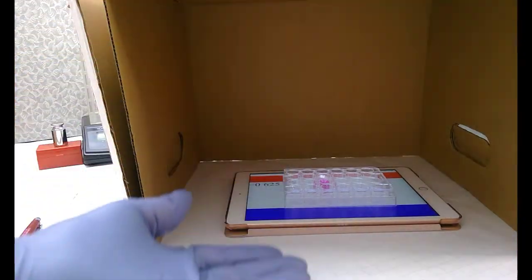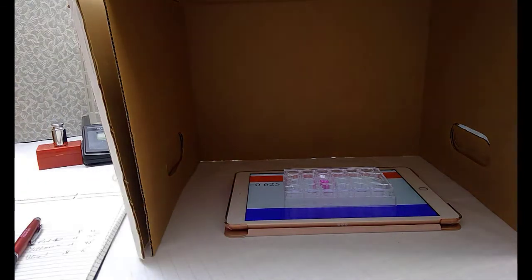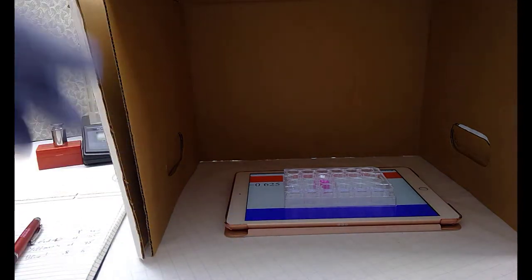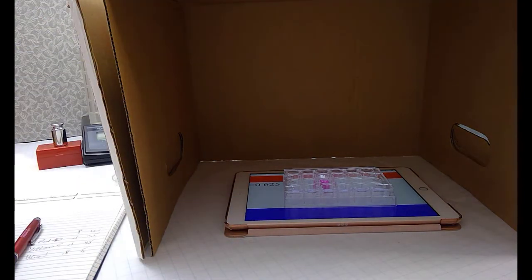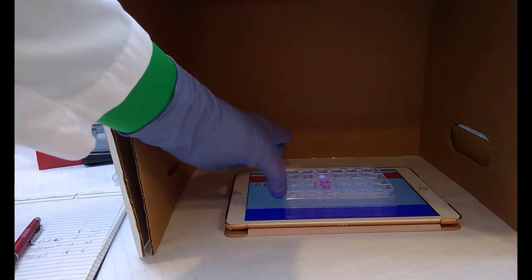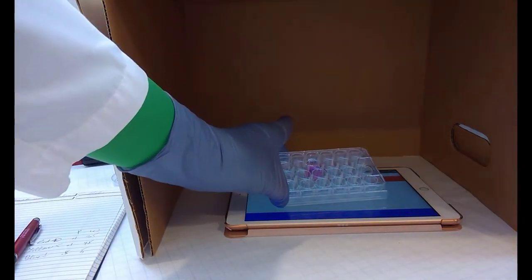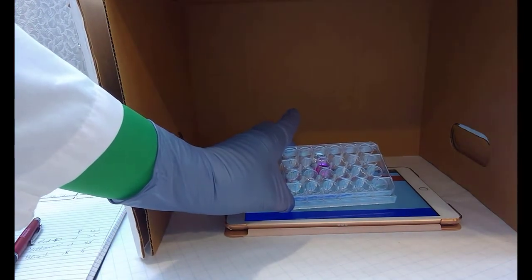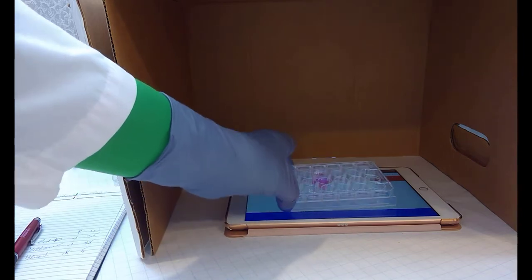My only source of light will be coming up from the bottom, the white light, the red, green, and blue that my iPad produces, and I'm going to take a photo of that phenolphthalein and also the clear solution next to it as a reference, because I've got both the phenolphthalein here, which is in one well, and an equal amount of water in the other well.